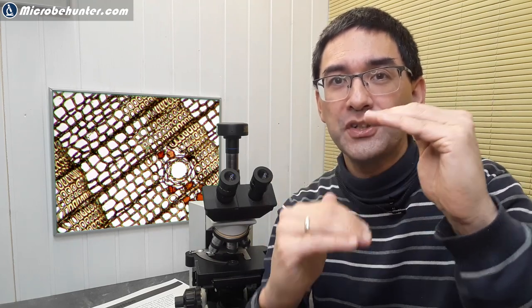However, this is a disadvantage in some cases because if you have, let's say that my two hands should represent the two parts of a specimen, one is further up and one is further down. If both of them are in focus, and if they're overlapping, then you're going to lose image information because the pictures are overlapping and you are not able to keep them apart. But if you open up the condenser a little bit, then either the top one or the bottom one will be in focus, the other one will be blurred out, and it's much easier to see them.